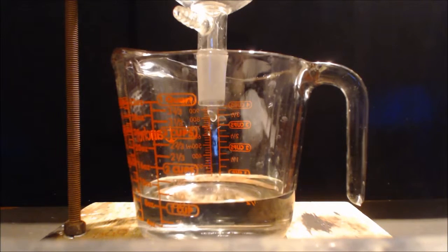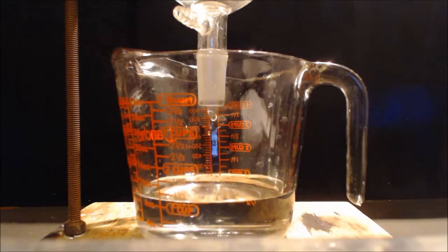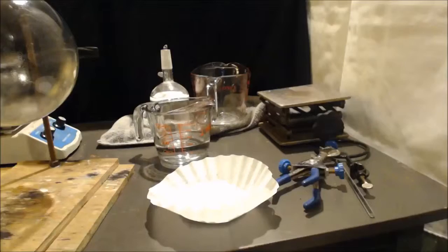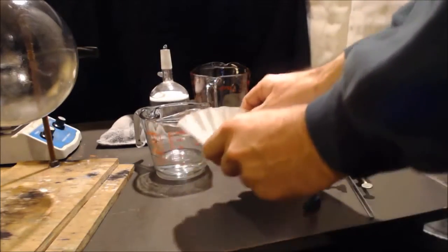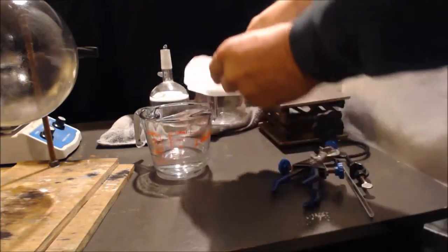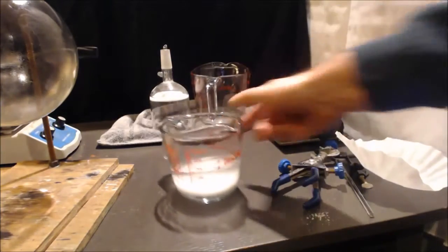And it's crystal clear. It was crystal clear the first time I did it through the frit, but I'm doing it a second time. Now I'm going to boil this up and make sure it's really nice and hot. Everything hot, including the frit filter funnel. I'm going to have everything hot. All right, I'm going to put this sodium hydroxide, like 95 grams, into this water, maybe about 200 milliliters. That should heat it up.